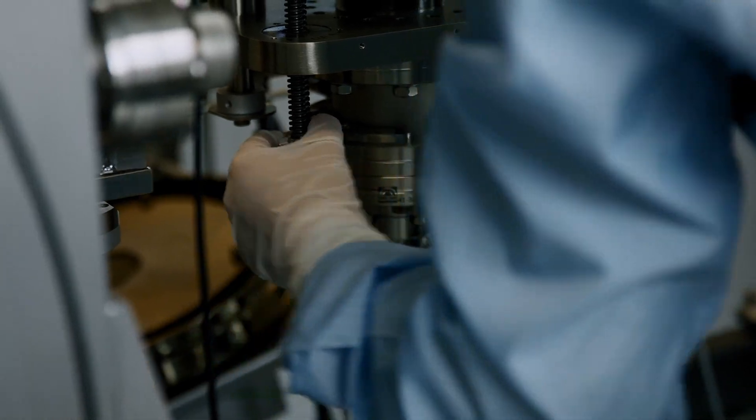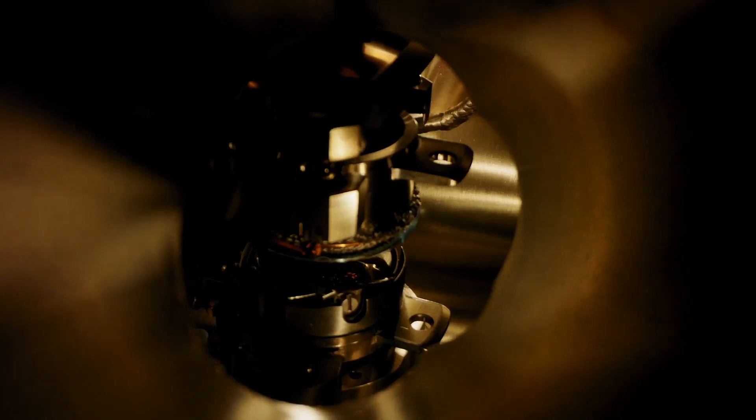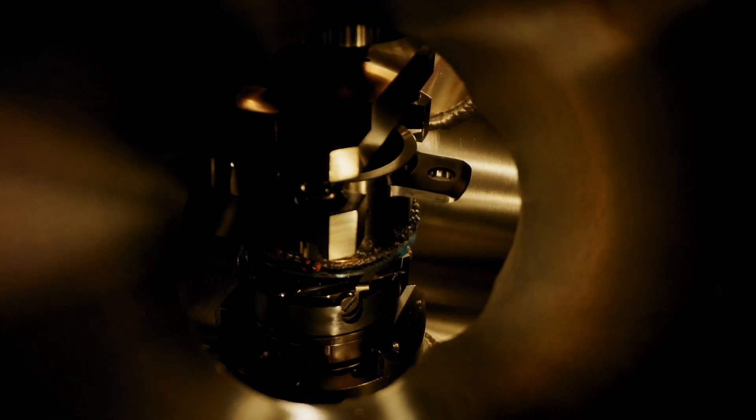The next steps are to exfoliate the different crystals we need. One after the other, we can use our anvil, which has two parallel stages, to exfoliate the different crystals one after the other.